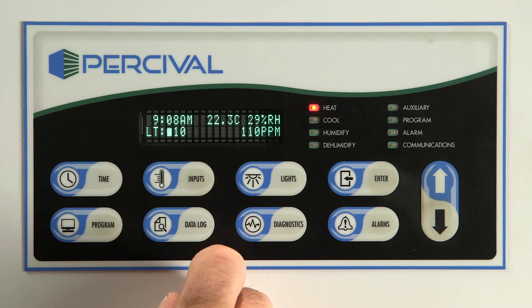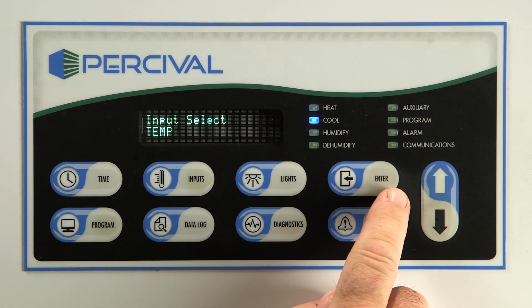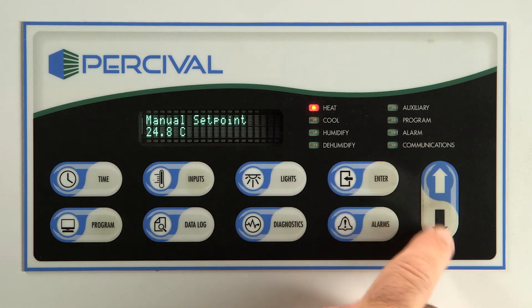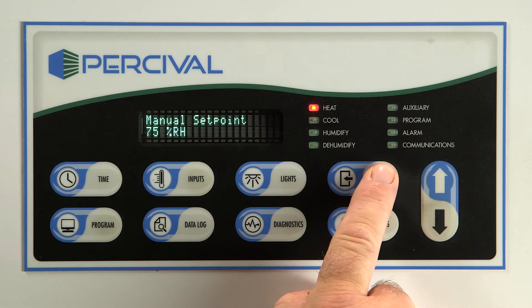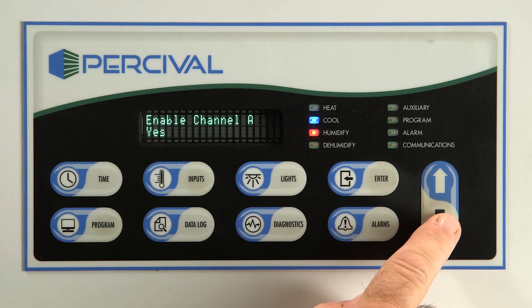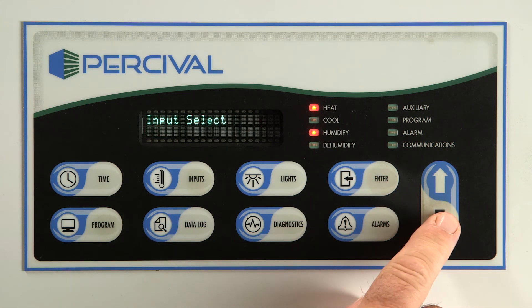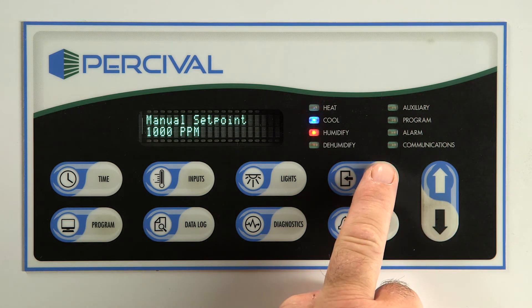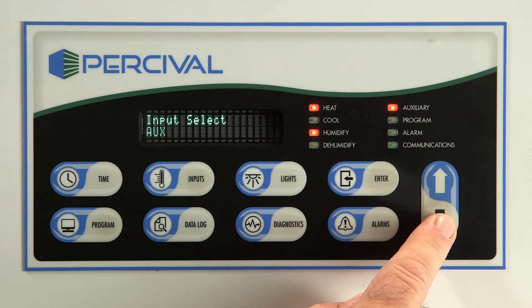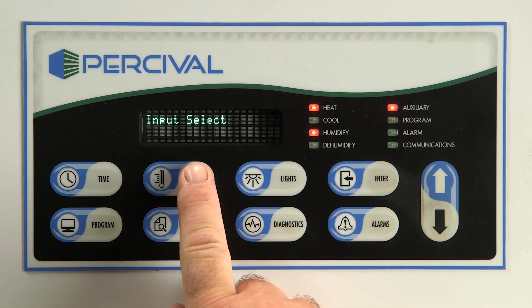The inputs key allows you to change set points and enable the humidity and auxiliary channels. To change the temperature, simply press the inputs key, causing the temperature to flash. Press enter to select — remember, to change a value, press enter first, make changes, then press enter again to save. You can use the down arrow to move to the relative humidity menu if equipped. Scroll down to enable the humidity system: channel A is additive humidification and channel B is dehumidification. Arrow down again for CO2 control — channel A is additive CO2 and channel B is CO2 removal. Below CO2, the menu will say LT1 if the chamber is equipped with closed loop lighting. To return to the main screen at any time, press the inputs key again.